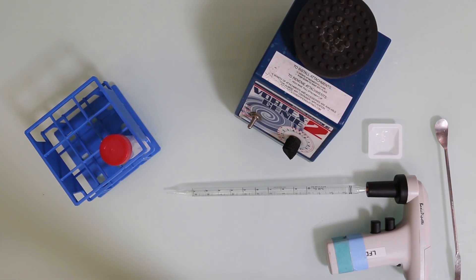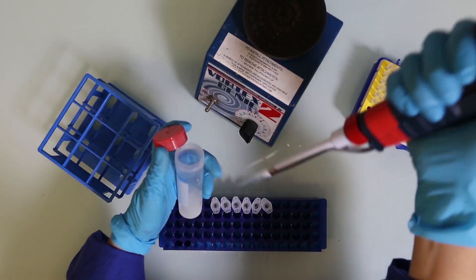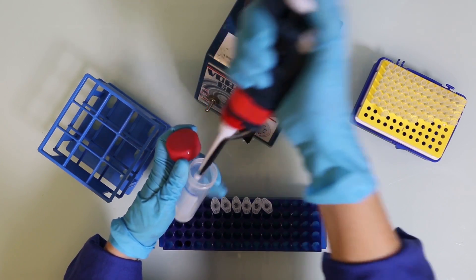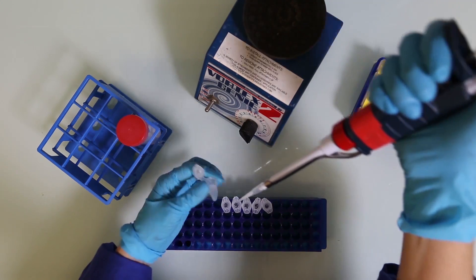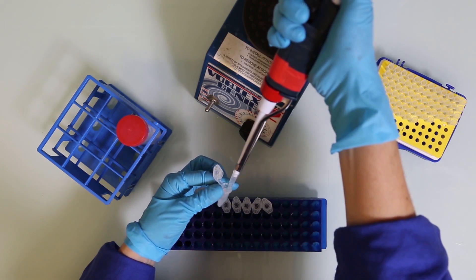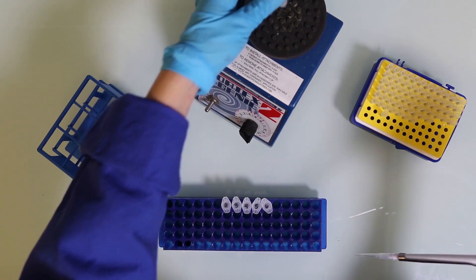Next, we can take 100 microliters of this dilution and mix it with 900 microliters of water. That makes a total volume of 1 milliliter and dilutes our solution 1 to 10. That's 10 times 10, and a final dilution of 1 to 100.